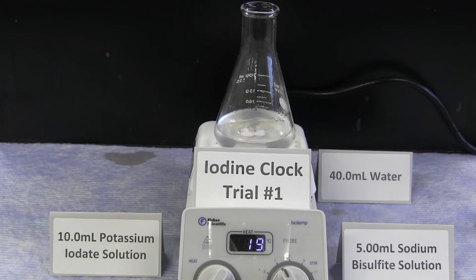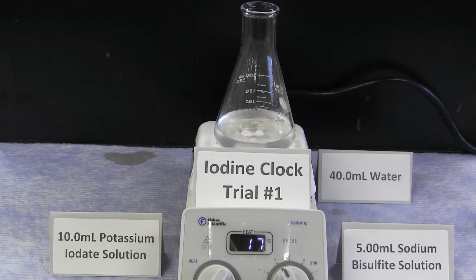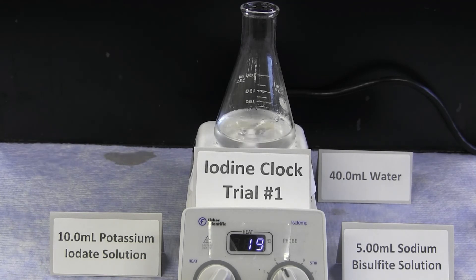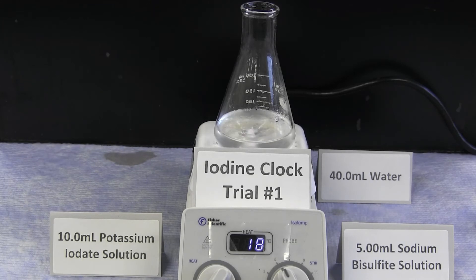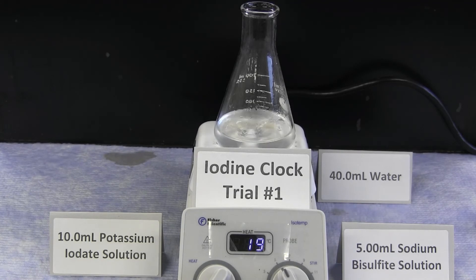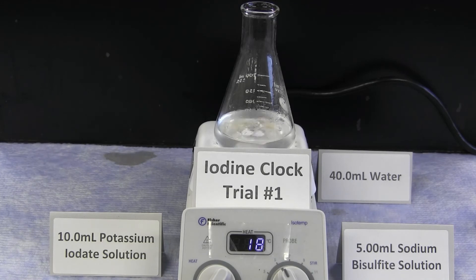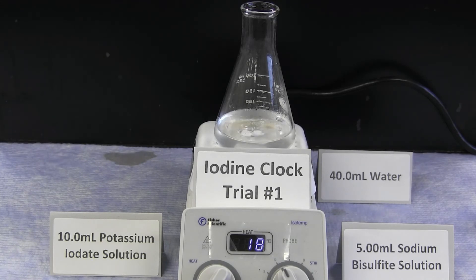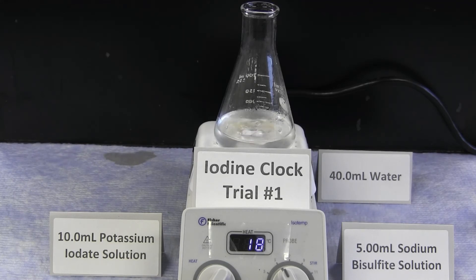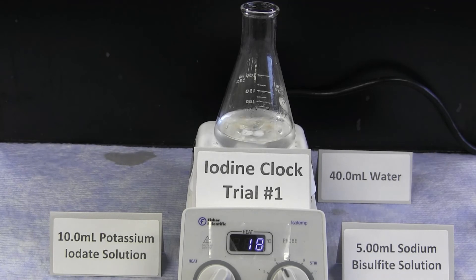By looking at the relationship between concentration of reactant and the reaction time, you can plot this on a logarithmic scale. The slope of the line which you plot in the report will be the reaction order of this reaction. It is already seen that concentration plays a critical role in the reaction time, where lowering the concentration, even a small amount, can have a large effect on the general outcome of the reaction time.